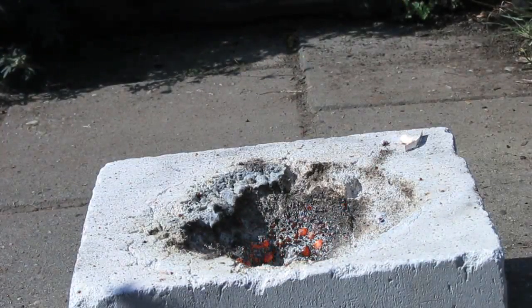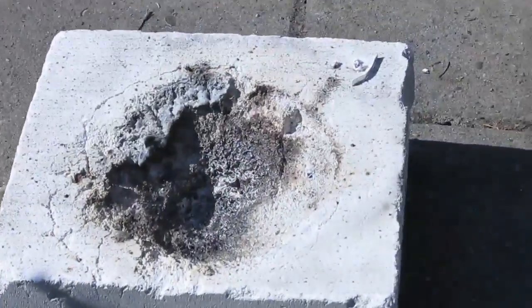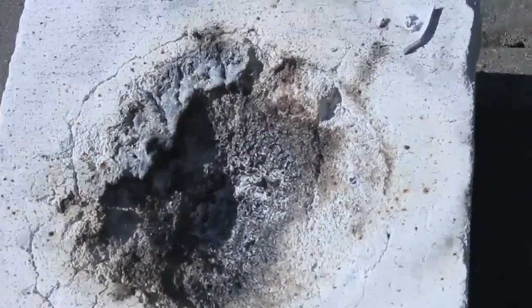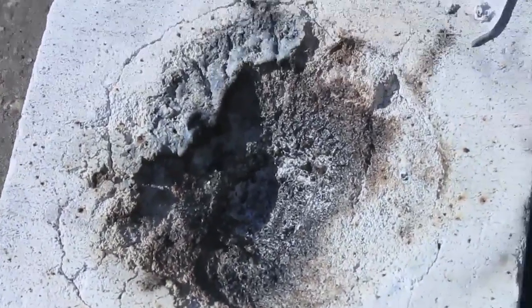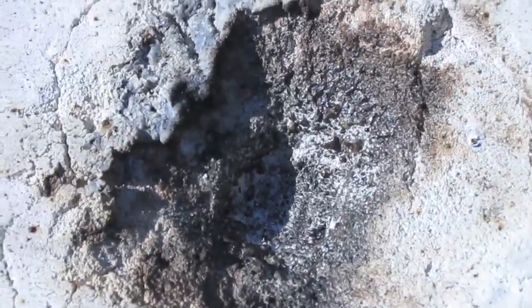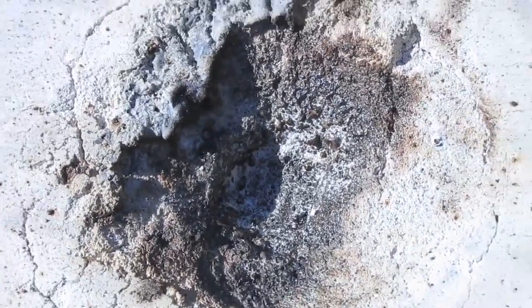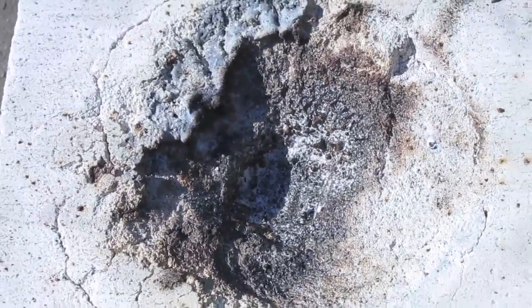So, this was very quick. Let's now look into the crater, into the pit, to see what's happened here. I see some pieces of metal in it, so there should be manganese metal in the crater.